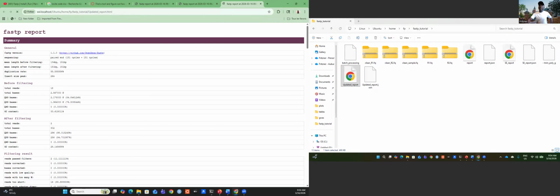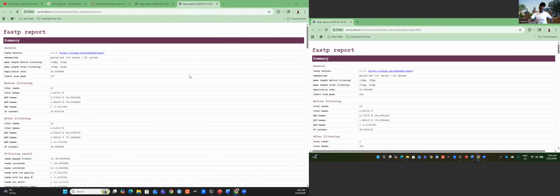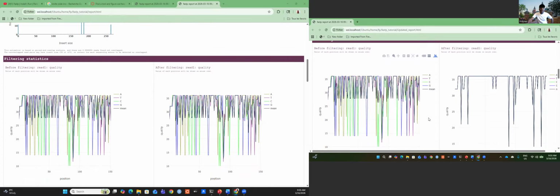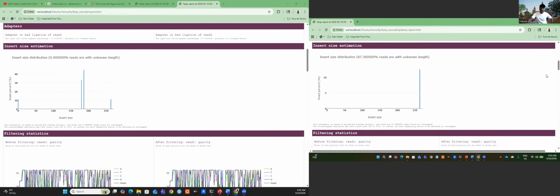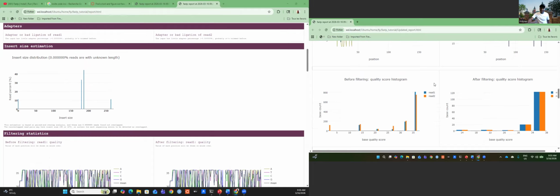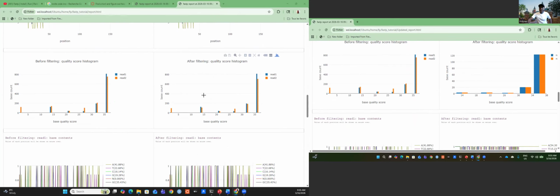Let me try to put them in different screens so you guys can see them. Yeah, this is the updated report. And I'm sorry, let me just, yeah, this is the first report. You will see the difference. Let's go to the graph, maybe for visual effect. Is there any difference? Yes, you can see the difference. And here, it is easier to see the difference. That's when you put more options, you will probably have different results based on what you are looking for.